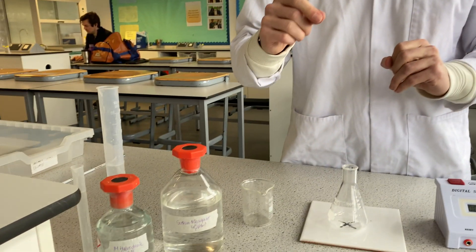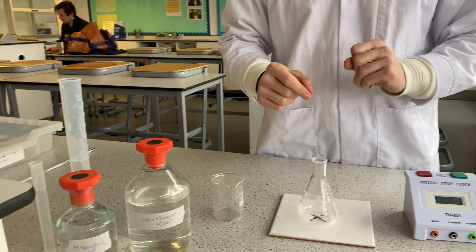Before we start — what was the initial aim of the reaction? The initial aim of this experiment is to work out how temperature affects the rate of reaction. So we're going to repeat this reaction at different temperatures and see how that affects the rate of our reaction.